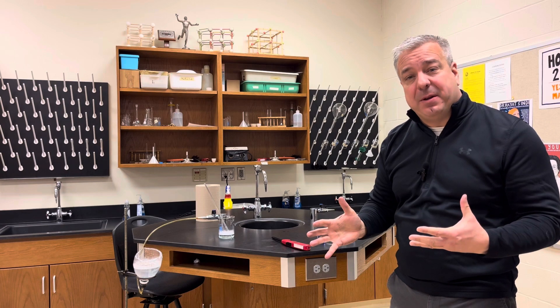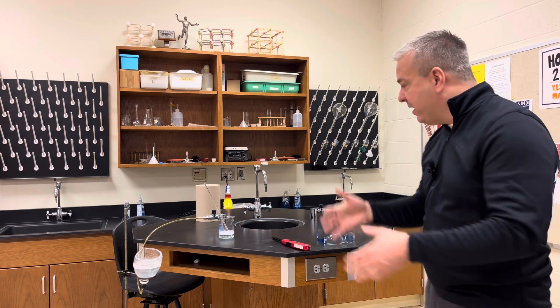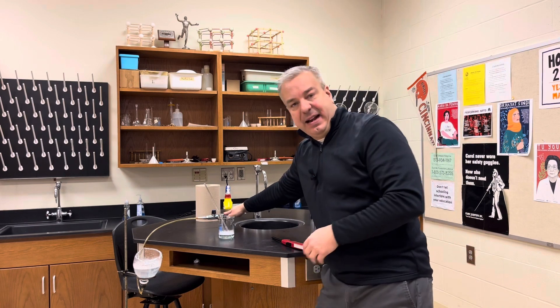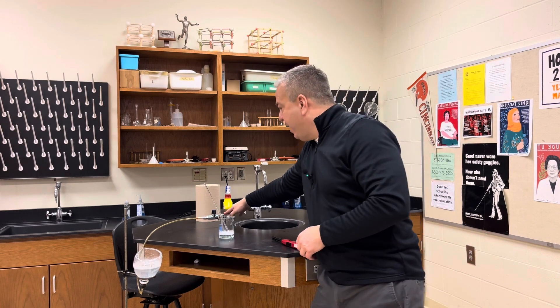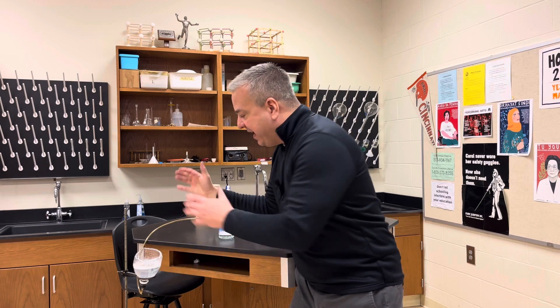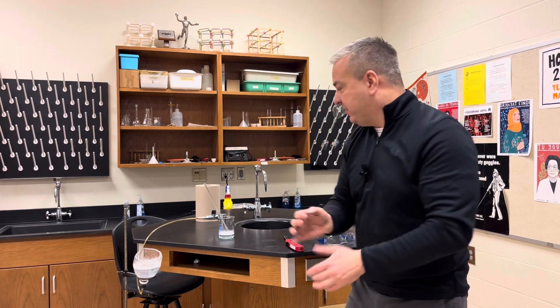What extensive property means is that the amount matters. The way this is going to work: we have methane gas in our chem lab, and we're going to push this methane gas through this tube into this apparatus that's holding soapy water.